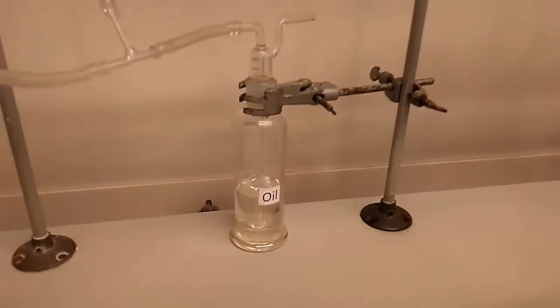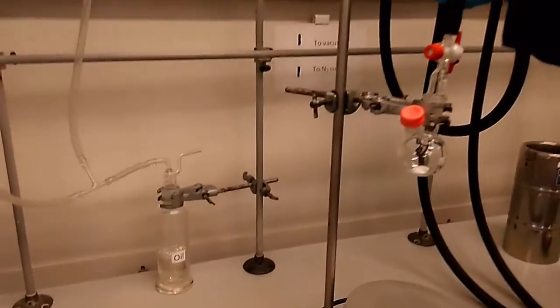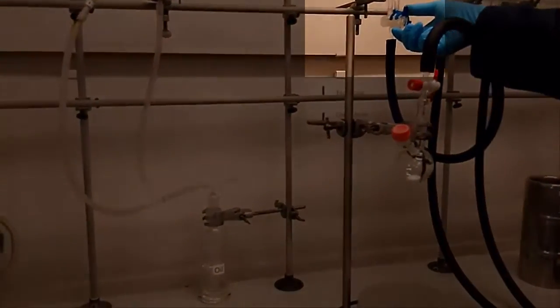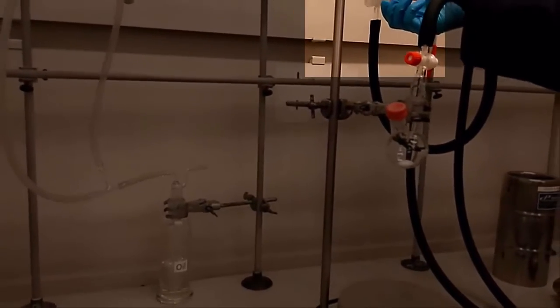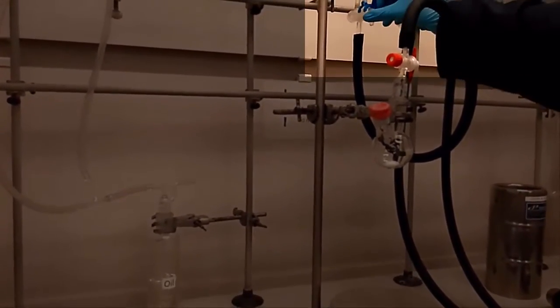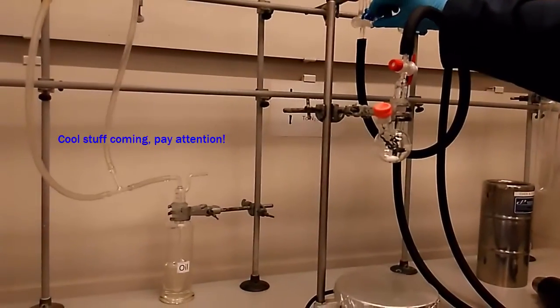And then now observe my right hand. Take a look at the glass stopcock. So as we rotate it to the nitrogen supply.